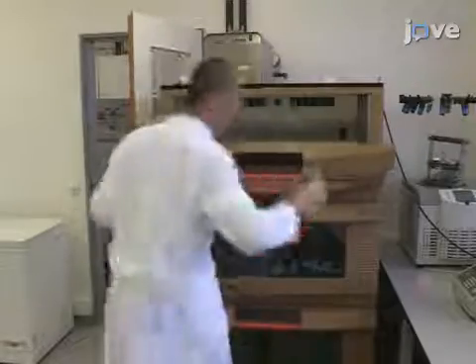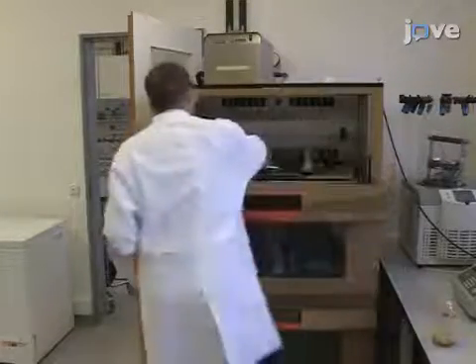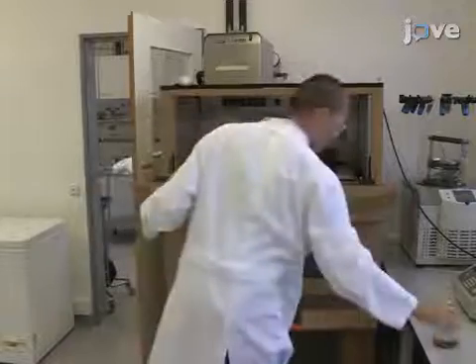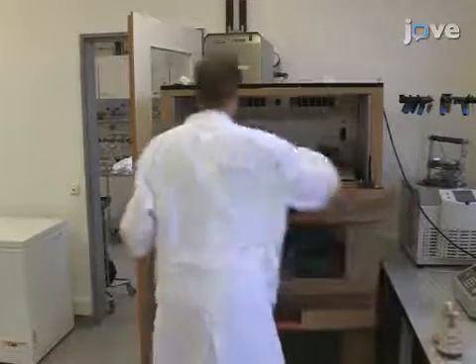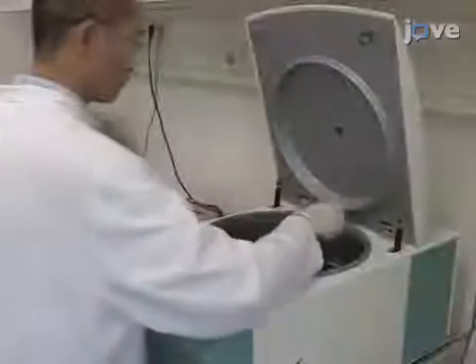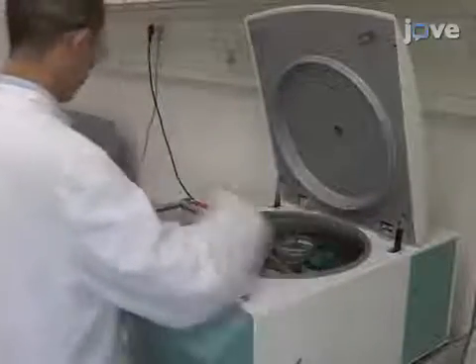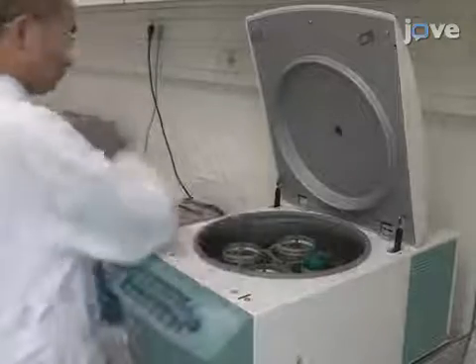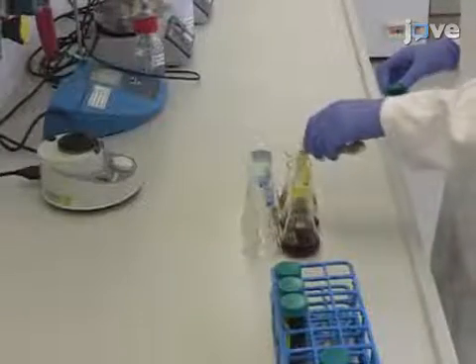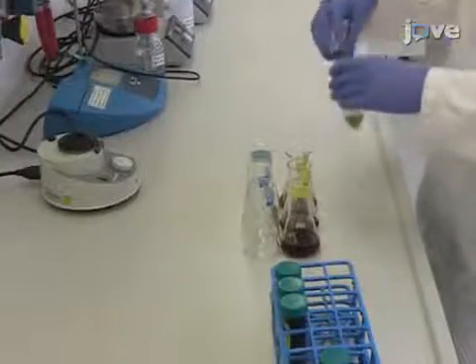To begin, grow the Streptomyces strain under different conditions like different media or incubation time. Harvest the cells by centrifugation for 10 minutes at 3000 times G and transfer the supernatant into a new flask.